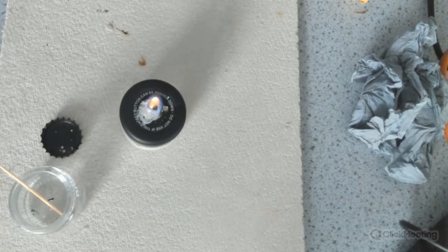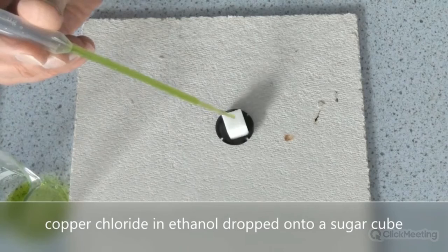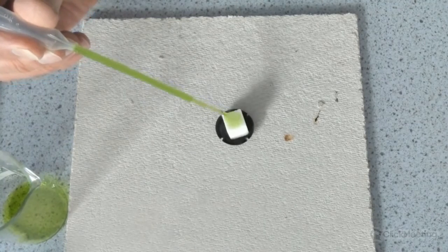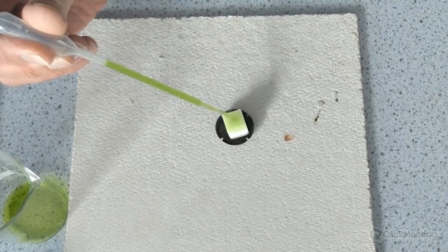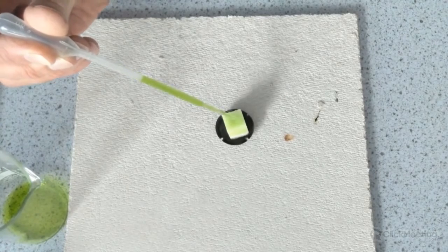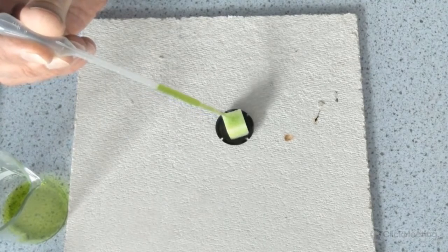Now, however, this flame is quite short-lived. If you want longer-lived flames to look at the color and maybe a more spectacular demonstration, then this setup is a useful one. I think this was developed by Magda Pollock and Bob Worley of CLEAPSS. Bob can maybe correct me on that. This basically involves a bottle top with the plastic burnt out. Onto that is put a sugar cube. And what I'm doing in this video is adding copper chloride, which has been dissolved in ethanol.